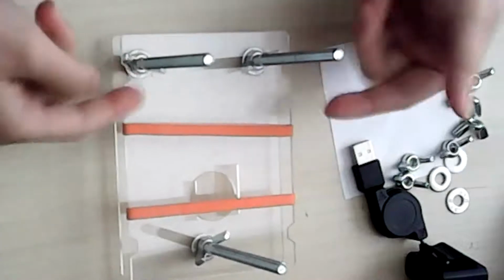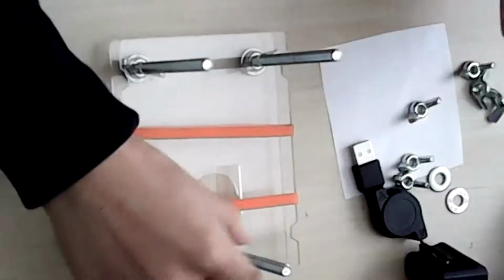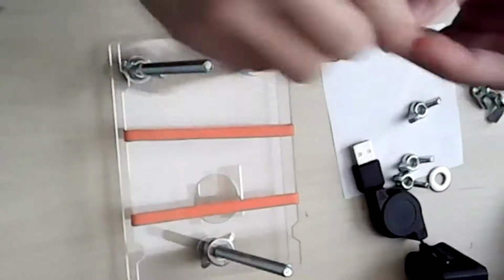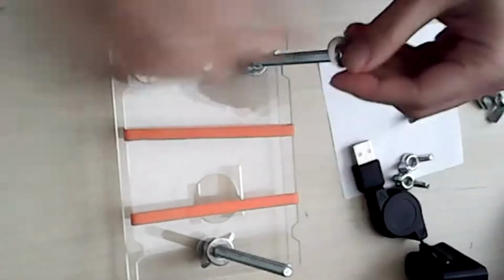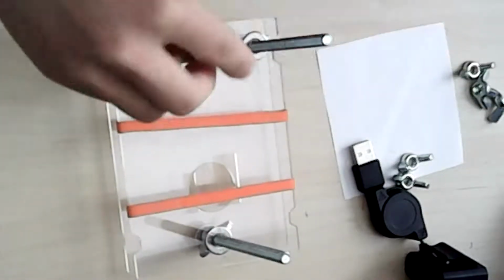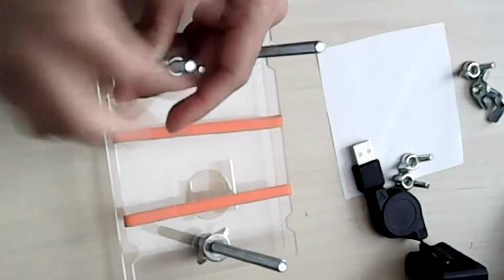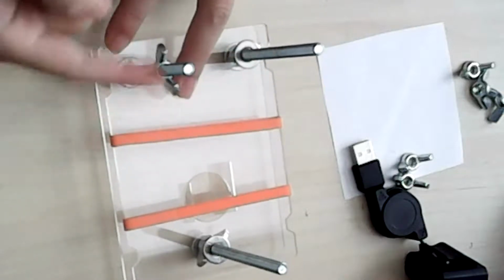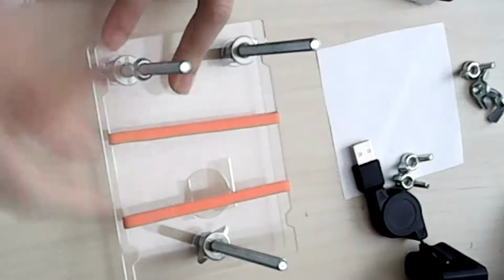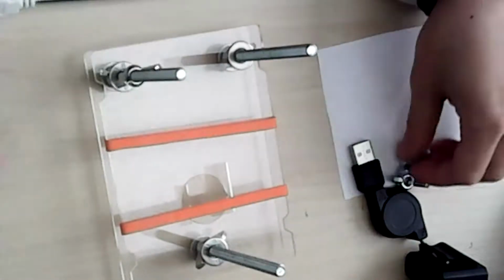And yeah, right now it's fine for them to just sit on top of this one. And same thing, you put the wing nuts and washers first, and then wing nuts. And if you find that your wing nut gets stuck in the middle, I recommend taking it out and redoing it. Because if it gets too stuck, it might break some of the ridges.